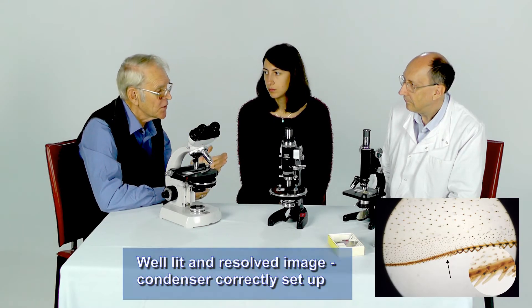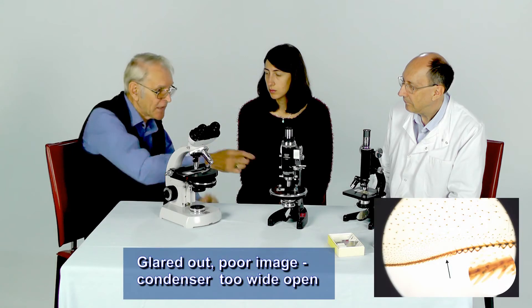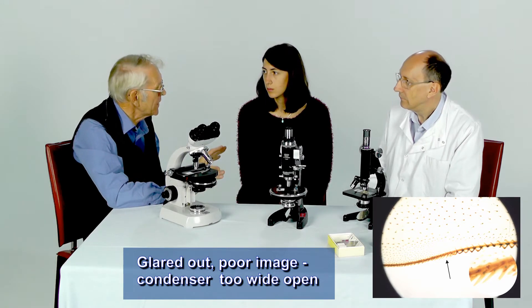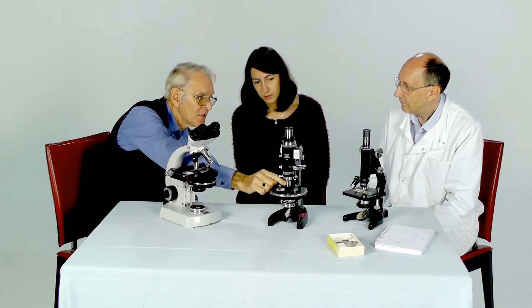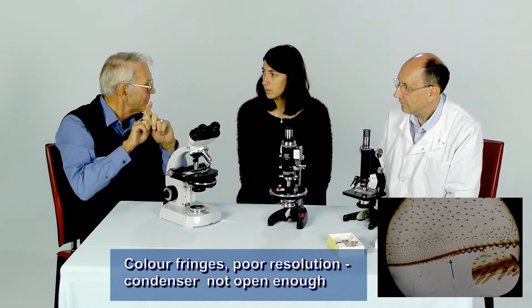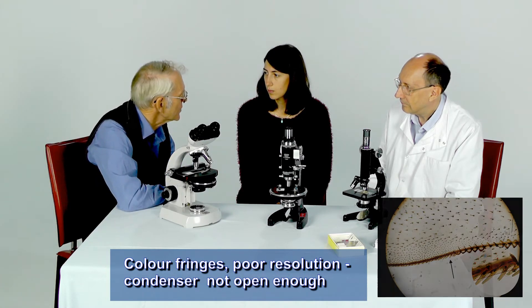The other thing that you need is enough contrast between the specimen and its background for you to be able to see the detail clearly. If you have too much light coming into the objective, it degrades the image and you don't get that contrast. On the other hand, if the cone of light that you're creating to go into the objective is not large enough, then you won't get enough resolution — you won't extract the detail sufficiently well.